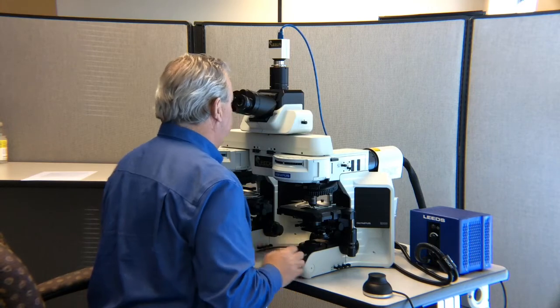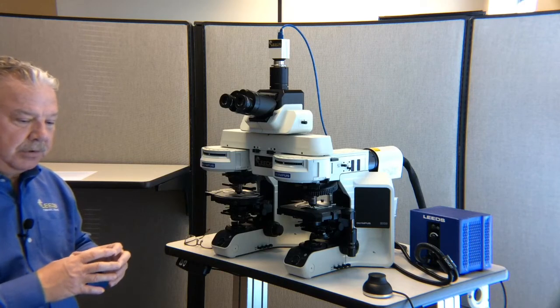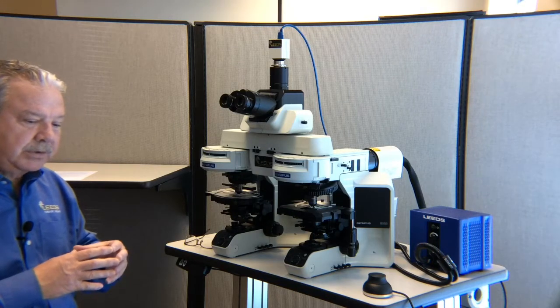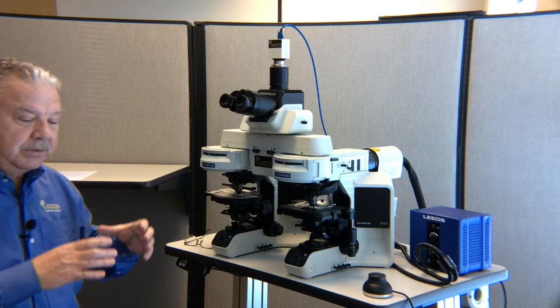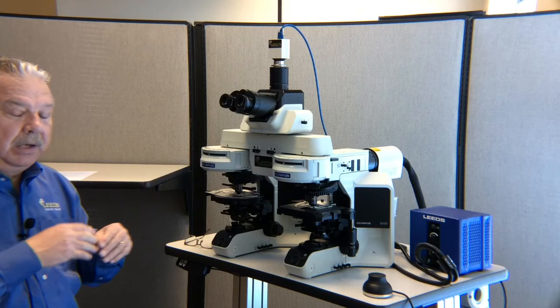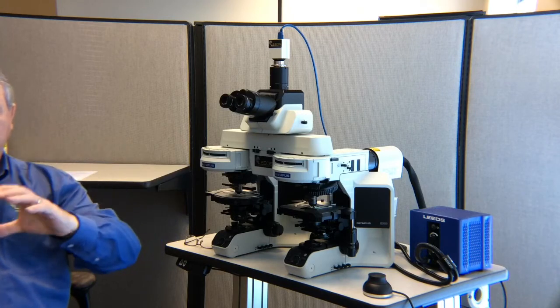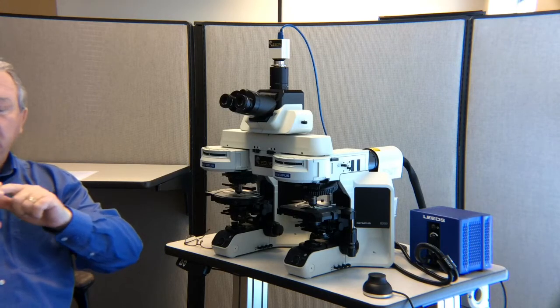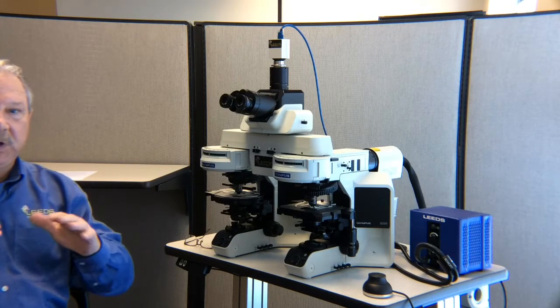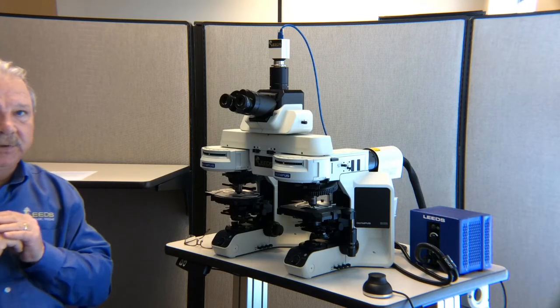The reason I do that, when you look at your field diaphragm, people have a discussion over where it is in focus. It's hard to see just when the edge is in focus of that leaf diaphragm. But what you'll see is there's a small area where there's a little bit of confusion about exactly where focus is. And what I want to do is form an image that's half the right side field diaphragm, half of the left side field diaphragm, and then I want to focus them both so that the fringe color around the diaphragm is the same color. It can be a little bit blue, it can be a little bit orange. I just want them both set to the same position.